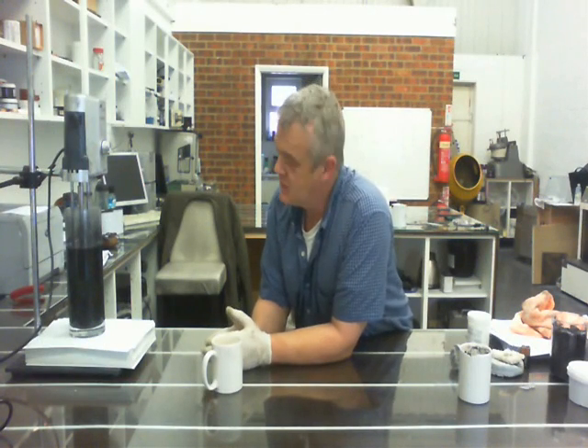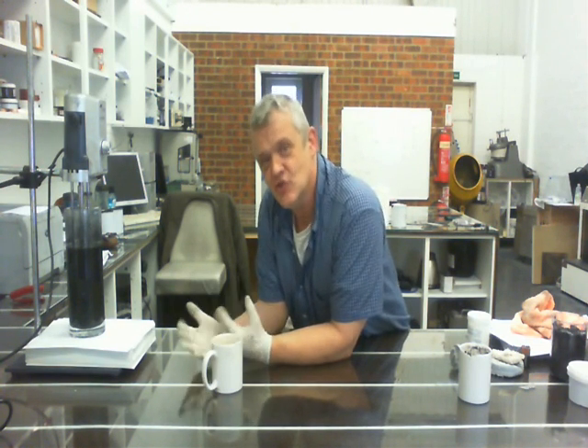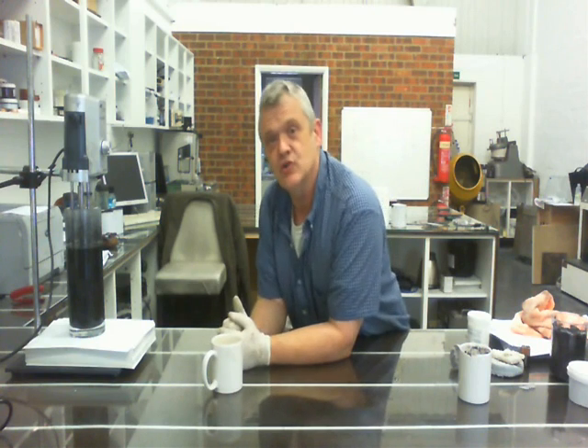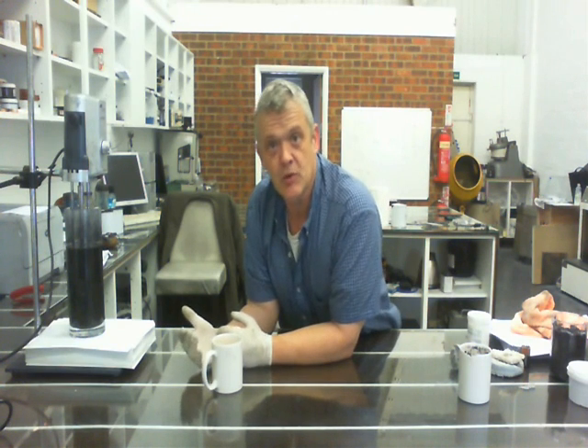Here we are half an hour later and I've turned it off. There's obviously quite a lot wrong with that experiment in terms of experimental design — for example, there's no temperature control, and you can see it's smoking away and it's actually very hot, because you're imparting an awful lot of energy to exfoliate the graphite and that energy heats up the water. When you first add the graphite you get silvery clouds moving through it, and as you continue the experiment those silvery clouds change until you get a black liquid with still a small amount of silver — that silver is unexfoliated graphite.